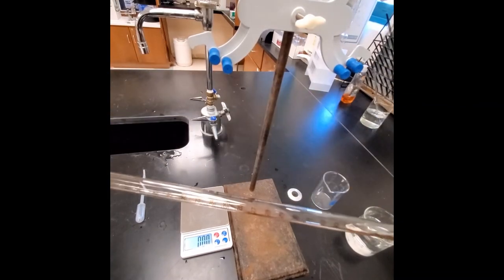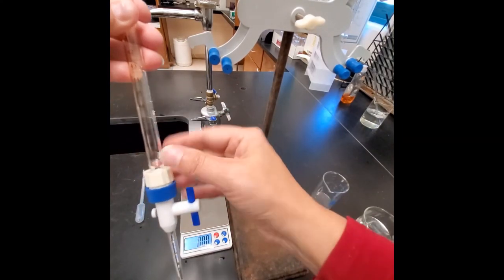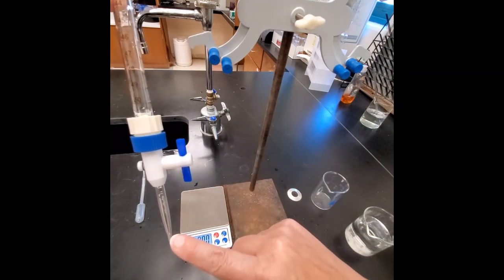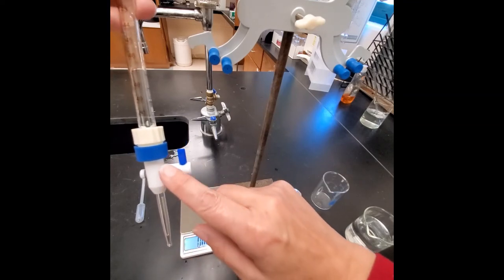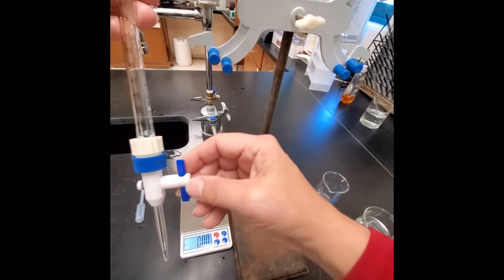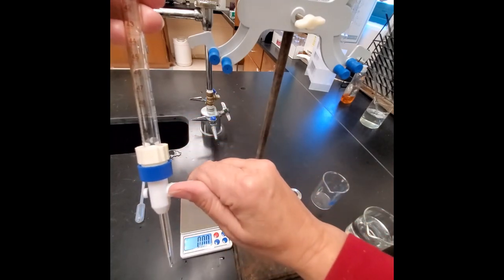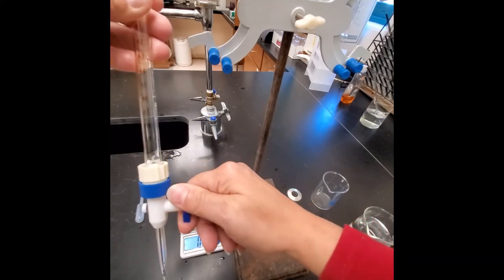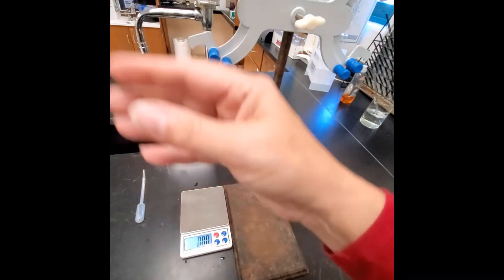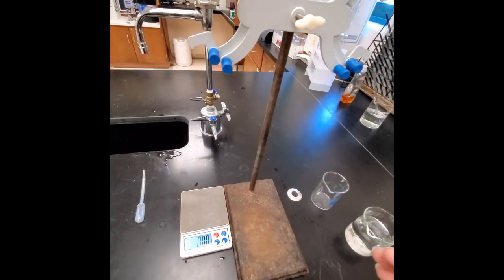The last piece of equipment is the burette — essentially a graduated cylinder with a valve apparatus and a tip at the bottom. This valve assembly is called a stopcock. When the handle is parallel to the burette, it's fully open; when perpendicular, it's fully closed. You can get drop-wise delivery by manipulating it slowly. Note that the markings go from 0 at the top to 50 at the bottom — the reverse of a graduated cylinder.